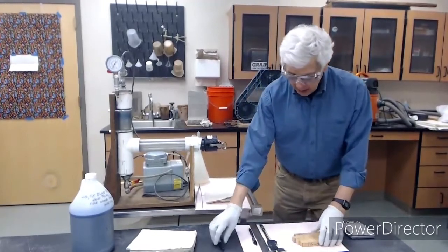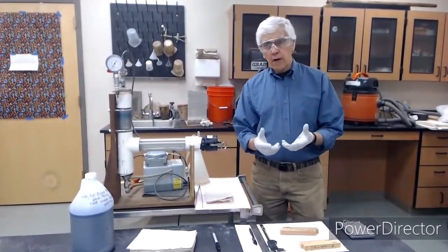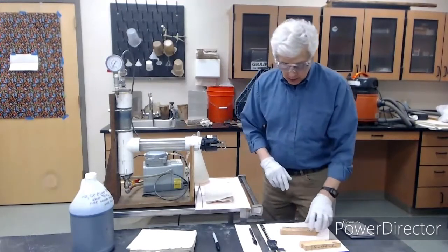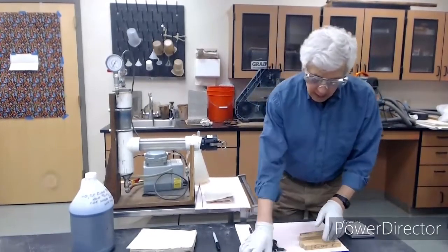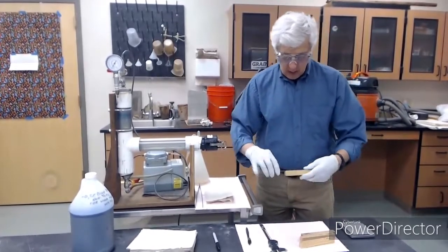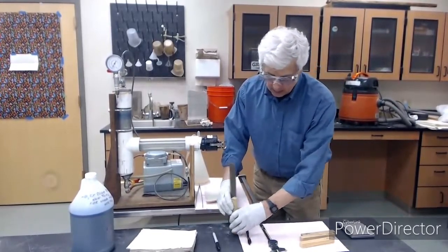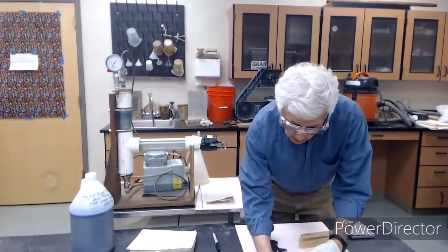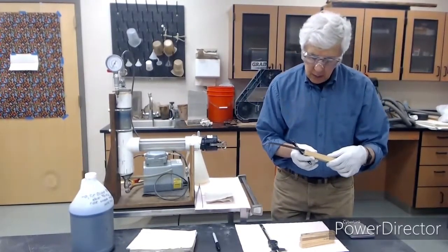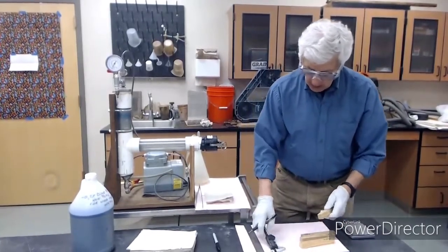Okay, now we need to measure the samples, because retention is the weight of the active ingredient, in this case the 0.5%, divided by the volume, right? So we need the volume. So let's get SYP1, and let's measure the length. And I get 15.2 centimeters. And we can measure the width and the thickness.